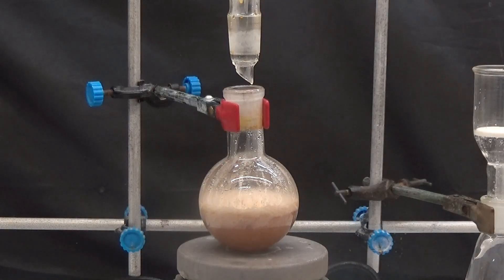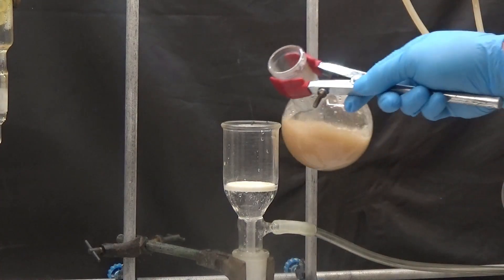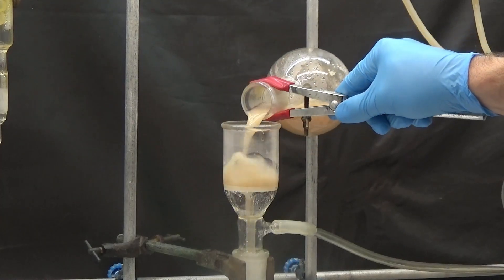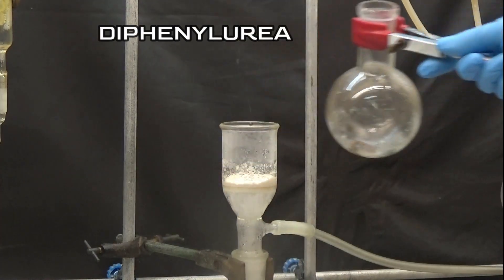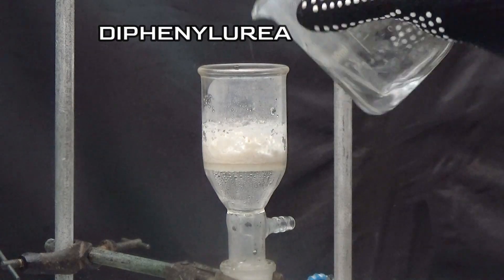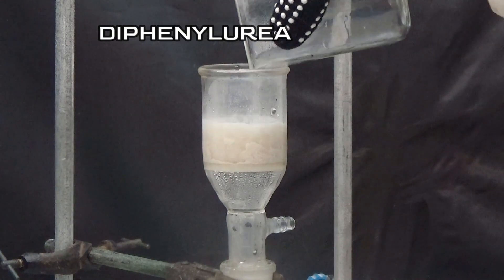After 2 hours of boiling, shut off the heat and gather the crystals that formed in hot. Rinse the crystals twice using 10 mL of boiling water.